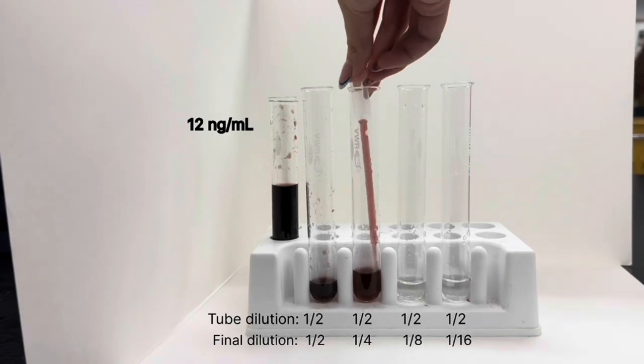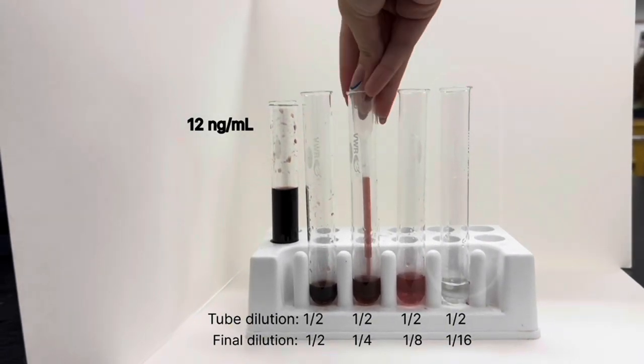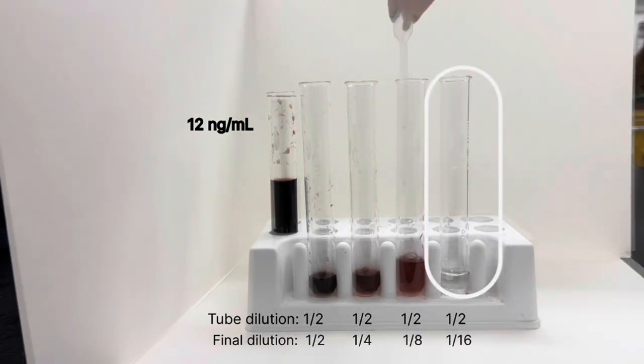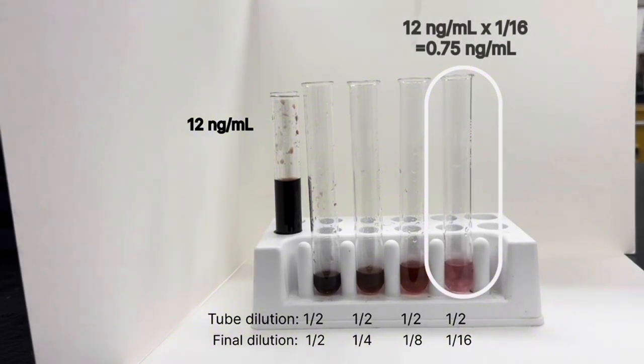The final dilution factors shrink exponentially for each tube as the concentration decreases. If we wanted to find out the concentration of the 4th tube, we would need to multiply the concentration of the stock solution by the tube's final dilution factor.